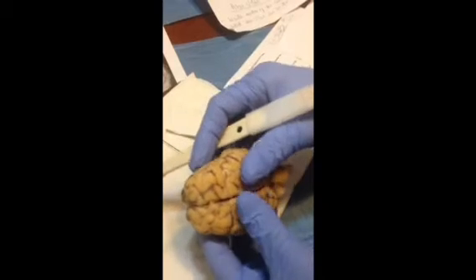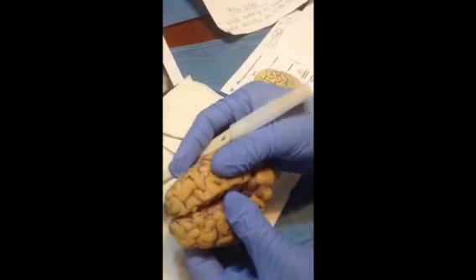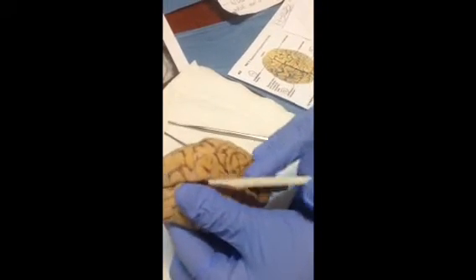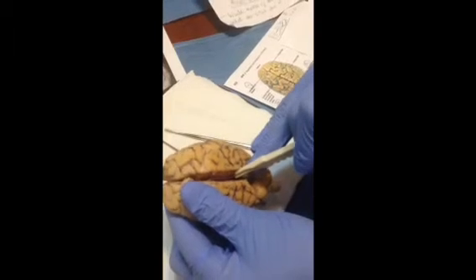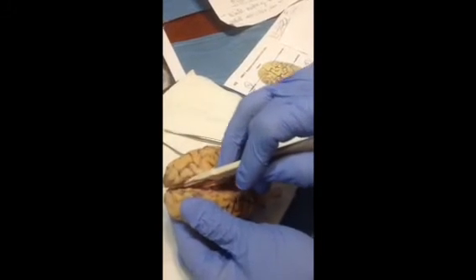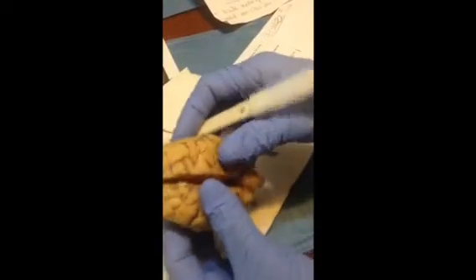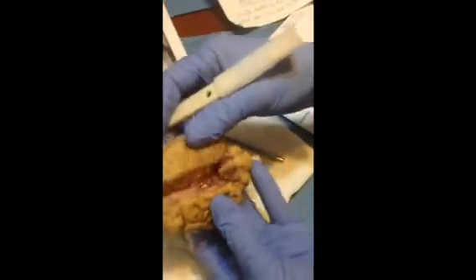Just a little slice through. Trying to watch my finger here. Okay.